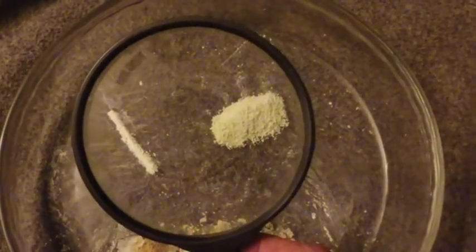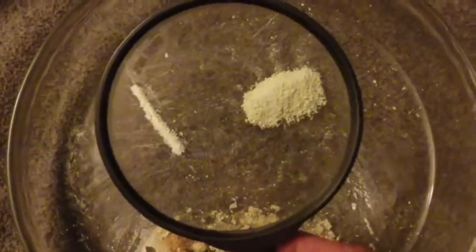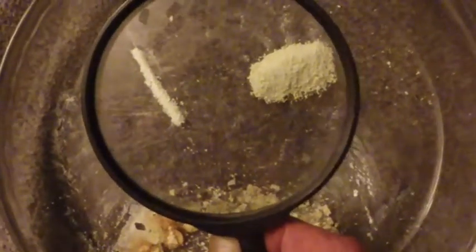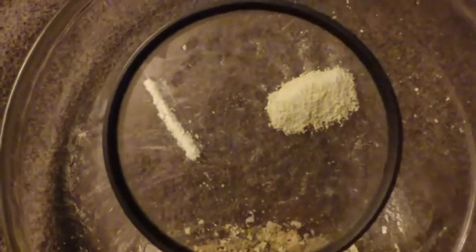Though I realize a lot of you are just going to go, 'What kind of drugs are you doing, man?' But as I said, this is entirely over the counter. All I did was a thorough cold water wash and one good filtration pass. And there we have it — a slightly off-white, if you look at it closely, just a tiny bit bluish, but you may not be able to see that in this light. Write down in the comments what you think this is. Later.